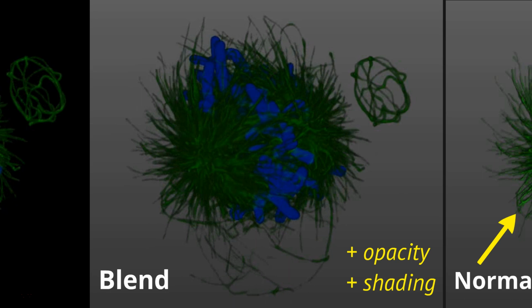So we also turn the background gray. The reason that we do that in Imaris is to help to emphasize the shading and the opacity, okay? So opacity is adjustable, so you can make it more or less opaque based on whatever it is you're looking for, and each channel can be adjusted independently of one another, okay? So the nice thing with this is I can now see that those spindles were all the way around the chromosomes. I have now some spatial idea of what's going on with that structure.